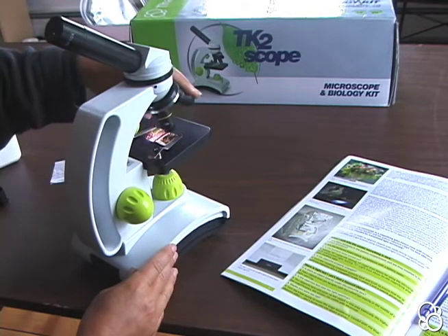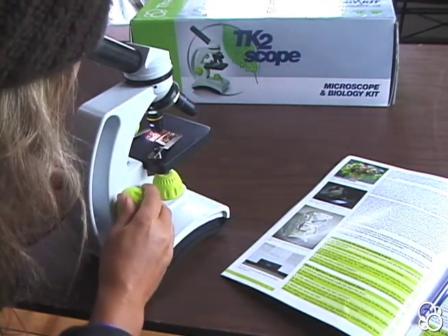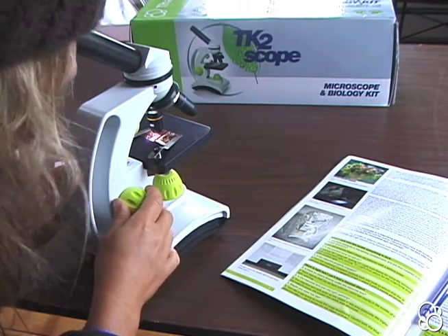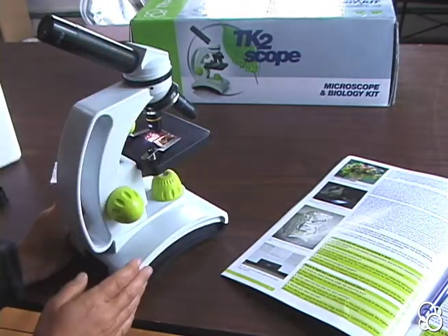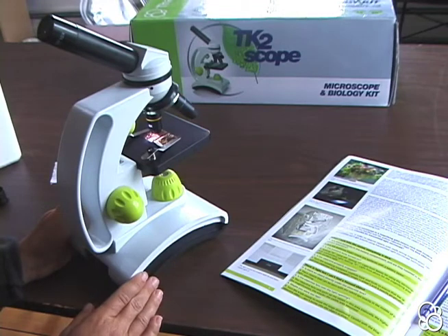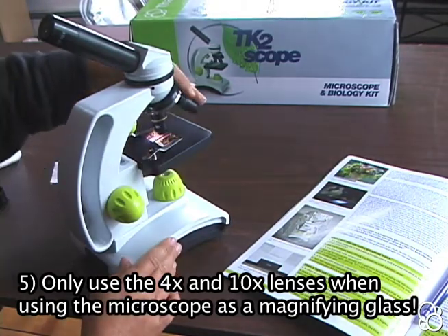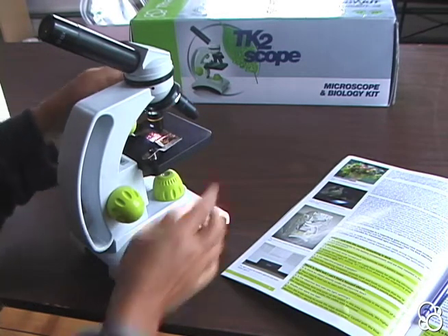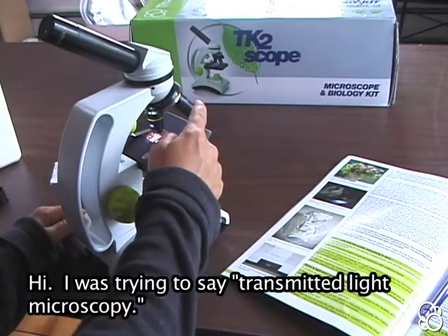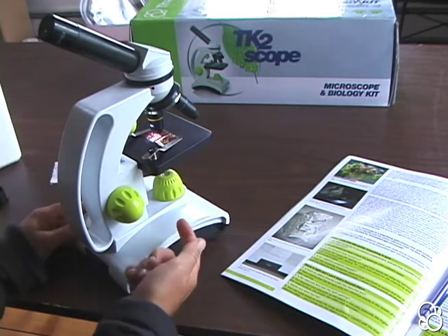You can also play with using a different magnification. Move it to the yellow objective lens — that's 10x — and look inside; you'll have to focus again. You'll probably still see dots, but this time you're seeing them closer because you're at 10 times 10, 100 times the magnification. When using the microscope as a magnifying glass, only use the 4x or the 10x magnification. Don't use the 40x, because that's only intended for transmitted light microscopy — in other words, only use 40x when the light is coming from below.